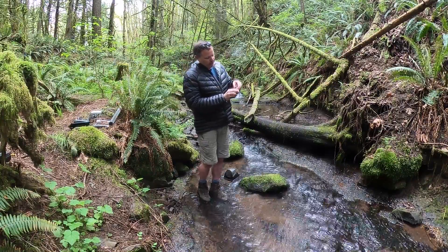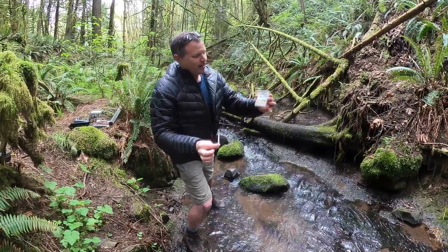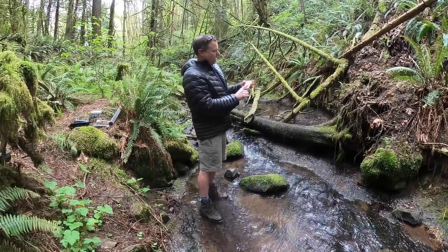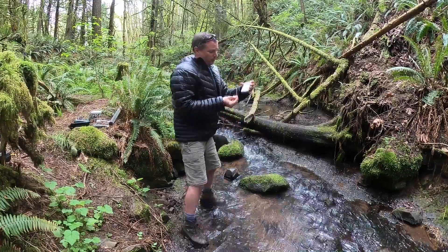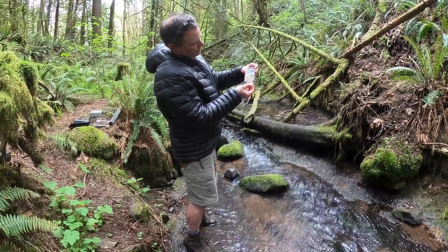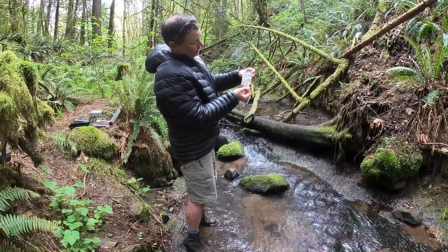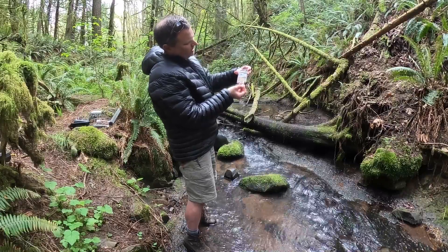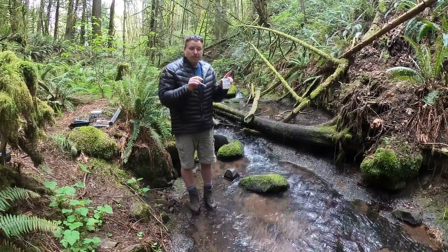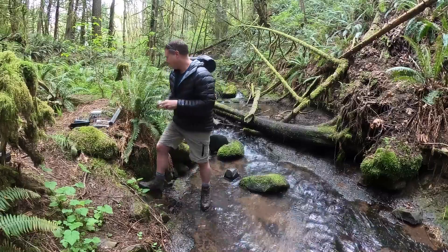With these pH strips — unlike simple litmus paper, these have four colors on them and a scale on the case. I know this water is probably going to be between 6 and 7. I give the strip a quick dip, then quickly look at it because the colors will change, and I match where I think it lands. After a couple seconds it's looking like about 6.5 — if I leave it too long it'll get dark. So water pH is slightly on the acidic side. For our fish — salmon, cutthroat, trout — that's perfect for them. Check on turbidity, looks good; check on pH, looks good as well.